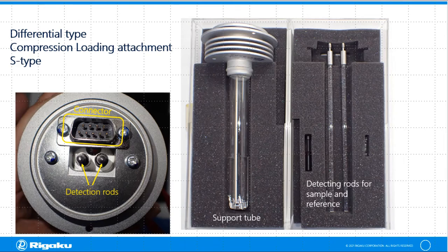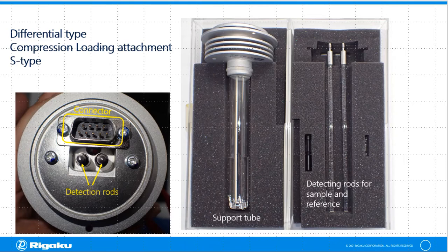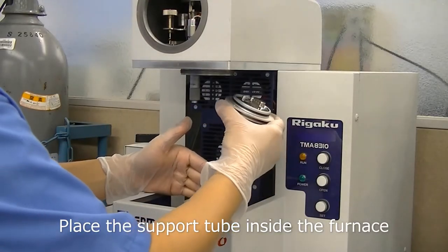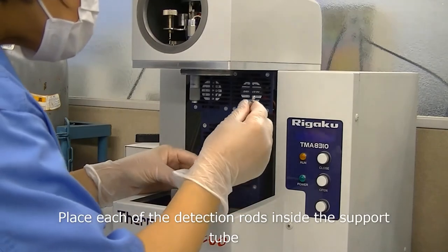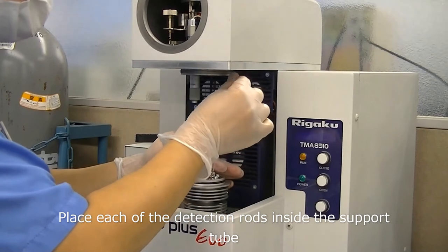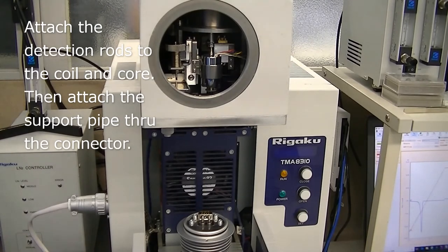This video shows how to install the differential type compression loading attachment. This is a differential type compression loading attachment with two detection rods — one for the sample and one for the reference material. First, remove the TMA cover by turning counterclockwise and make sure the power is off. Place the support tube inside the furnace. Then place each of the detection rods inside the support pipe.